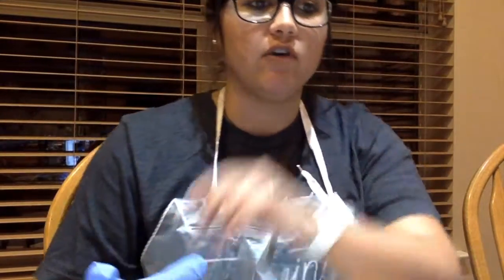This is Gabby Delapiani for Chem 1412, and I am performing Lab 9, the determination of vitamin C by redox titration. So I've done all my preparation, and now I'm on activity 1, developing the standard curve. I've created all my solutions in my cups. I've got my unknowns over here, but I'm not really on the unknowns yet. And then I have my waste cup.